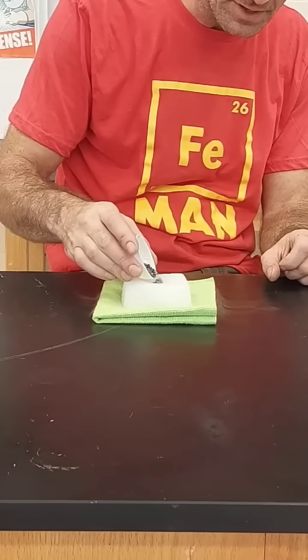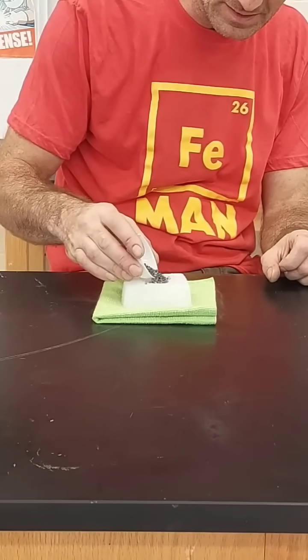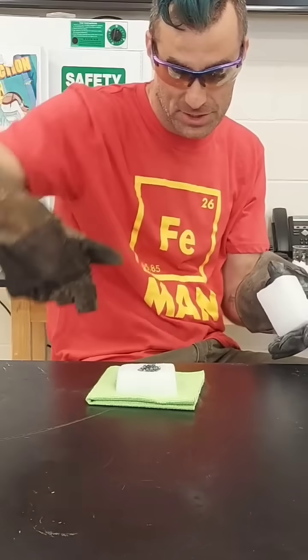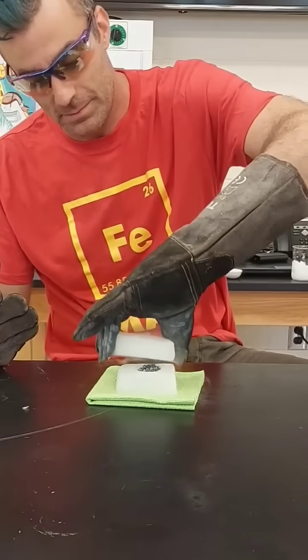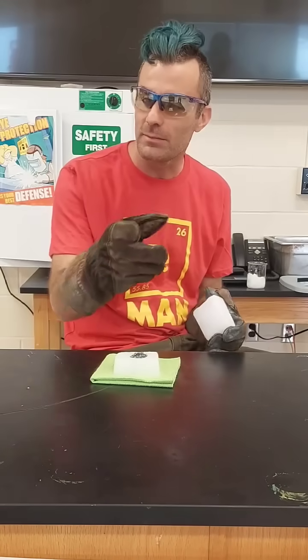How about magnesium, element number 12? It burns very hot, and in a moment I'm going to light the magnesium on fire and put another block of dry ice on top. What do you think is going to happen?